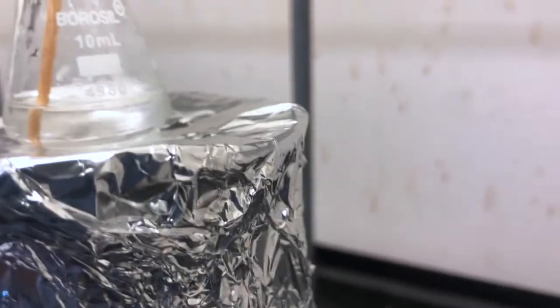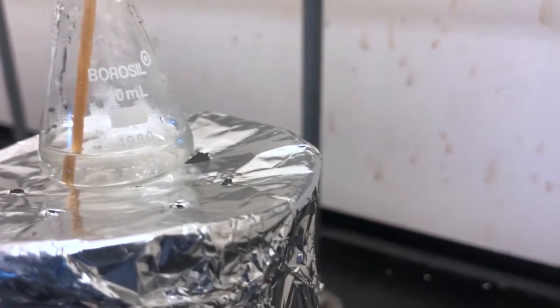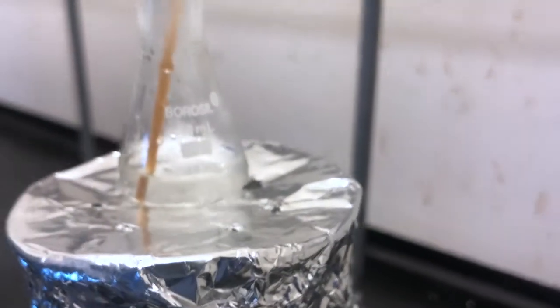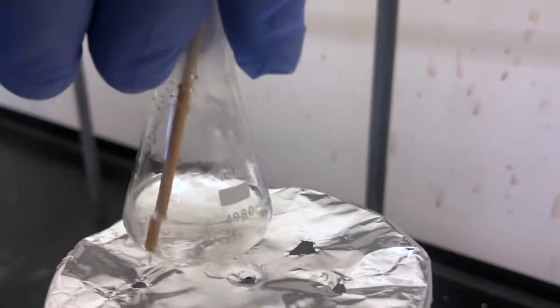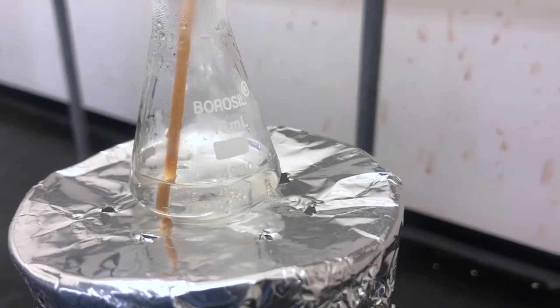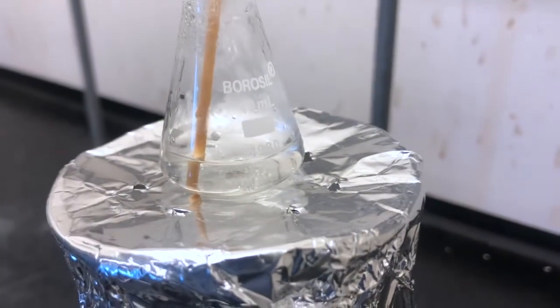But again, the key at this stage is to dissolve it in the minimum amount of solvent at the boiling point, so that we get a nice clear solution at the boiling point, and we've only added a minimum amount of the recrystallizing solvent. If you add more than you need of the recrystallizing solvent, it will all dissolve, but it'll become even harder to take it out of solution.